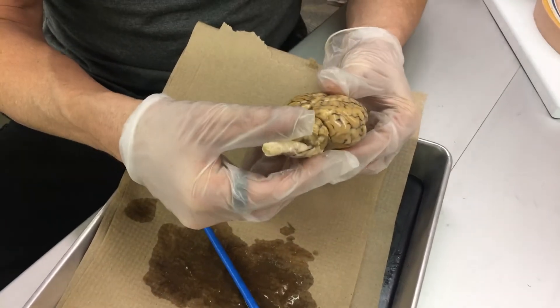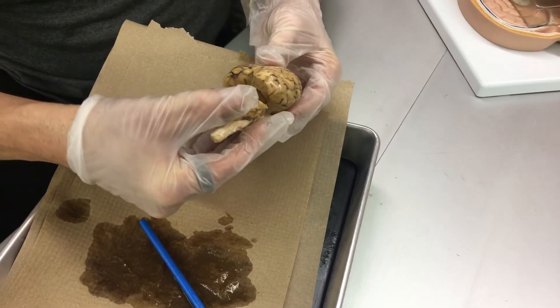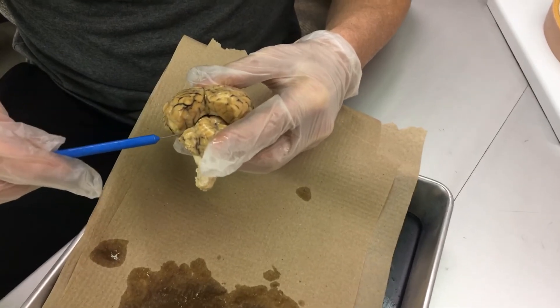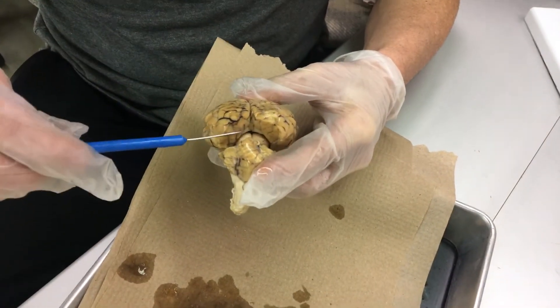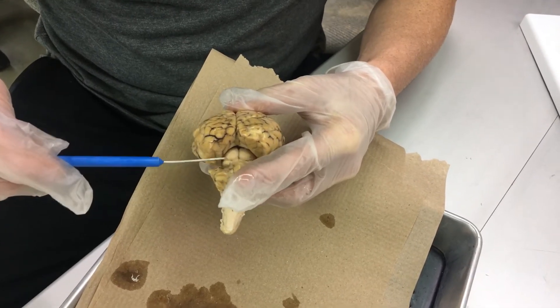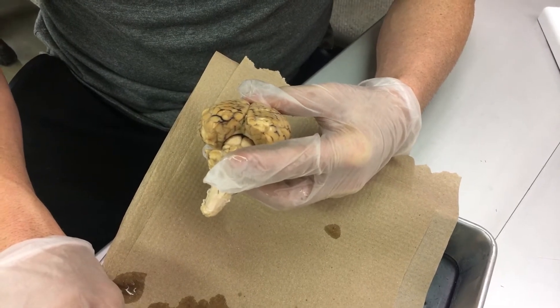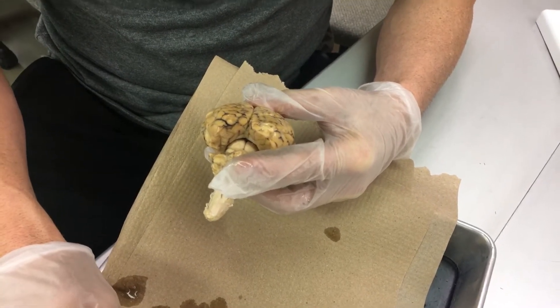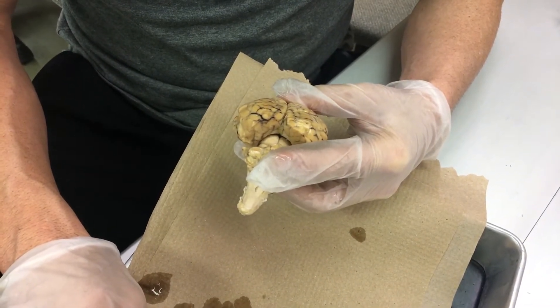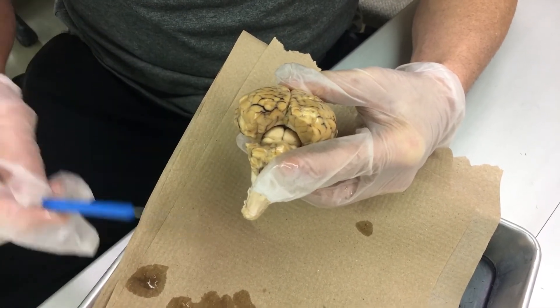If we kind of separate the cerebellum from the rest of the cerebrum, you can look in there. This part right here is the midbrain looking from top down. These two little mountains — these little humps — are called the superior colliculi, and below those are the inferior colliculi. Those deal with visual and auditory reflexes. So if you see something in your peripheral vision and reflexively look, or you hear something and reflexively turn your head, those are the superior and inferior colliculi that do that.